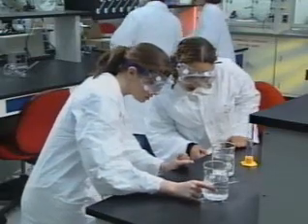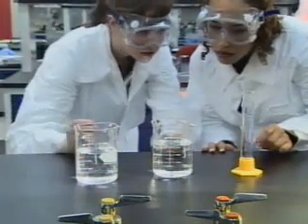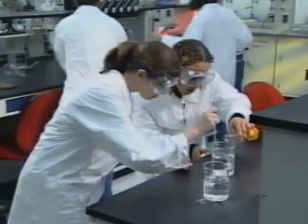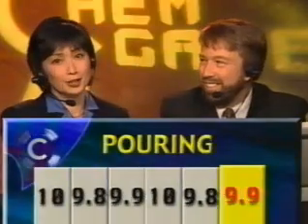Over here, there's some pouring going on. What do you think, Adam? Seems like she's diluting acid. It's decision time. Will she pour the water into the acid or vice versa? She lifts the acid and pours while stirring. Yes, what a play. The judges agree, a 9.9.